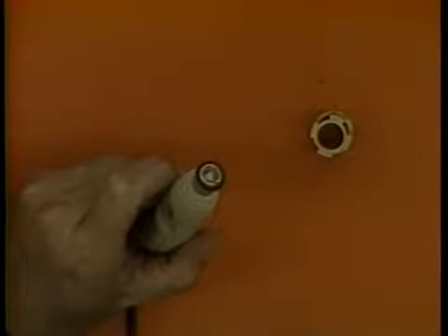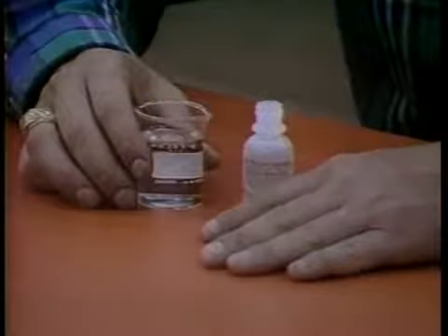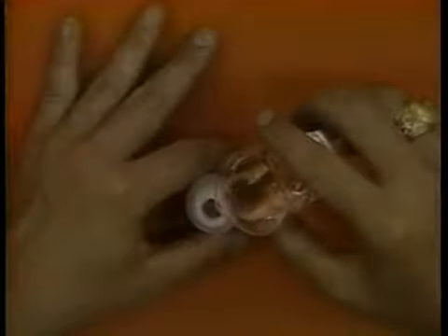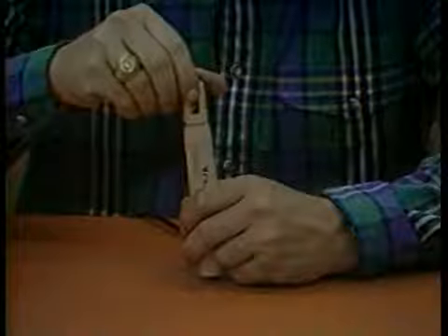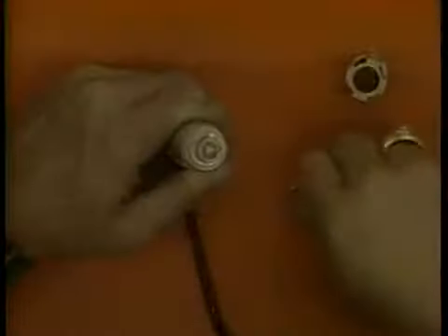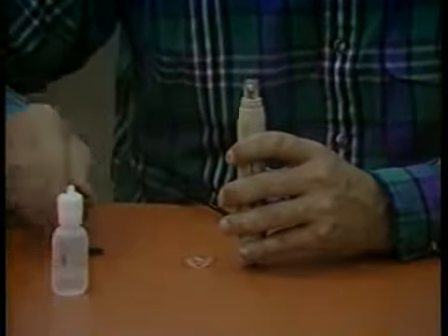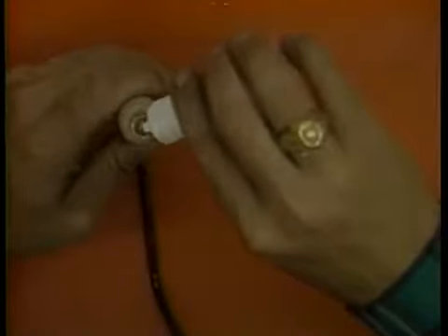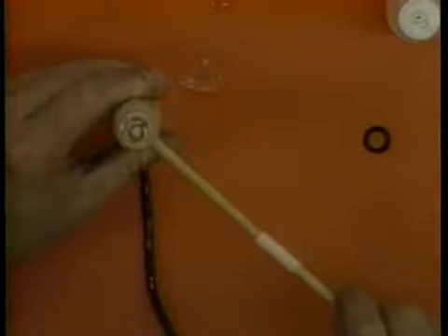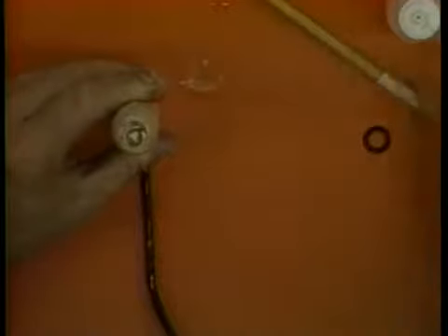To change the membrane, proceed as follows. Prepare the potassium chloride probe solution by dissolving the crystals in distilled water. Unscrew the protective cap and remove the O-ring and the old membrane. Rinse the exposed sensor thoroughly with the probe solution. Grasp the probe in your left hand and fill the sensor body with the probe solution while pumping the diaphragm button with a pencil. Continue to fill and pump until no air bubbles are present.